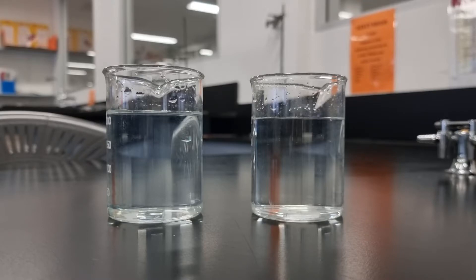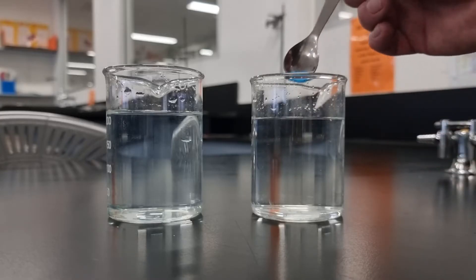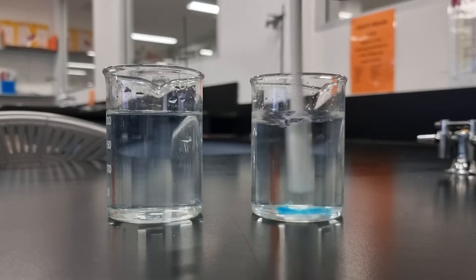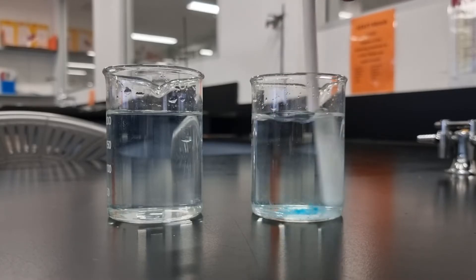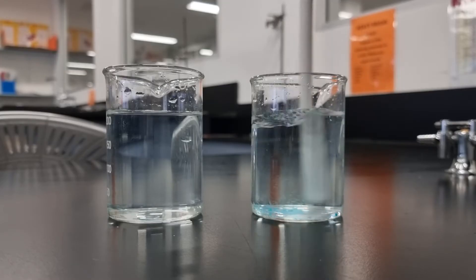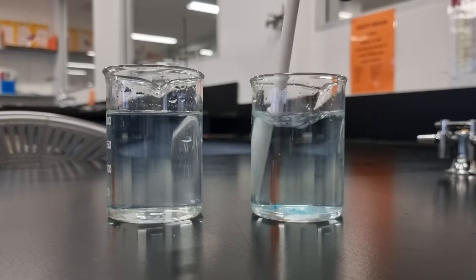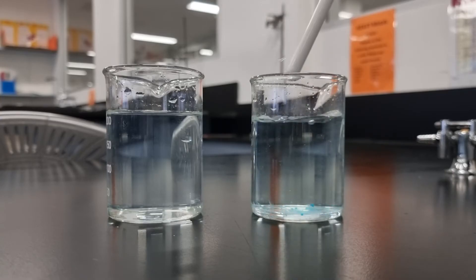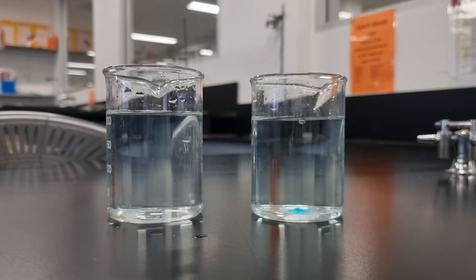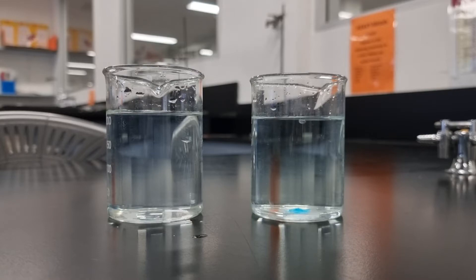I have a solute of copper 2 sulfate. I'm just going to put a little bit into the beaker on the right and give that a quick stir. This copper 2 sulfate is fairly water soluble so it should dissolve fairly readily. It might need a bit of a stir but it will dissolve, and possibly you can see in the video — hopefully you can see — I can, looking at my phone screen, I can see that there is a faint blue colour.